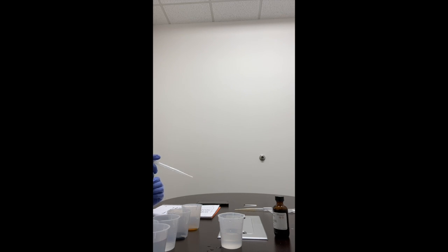Put it into the dialysis bag. There's 8 milliliters.